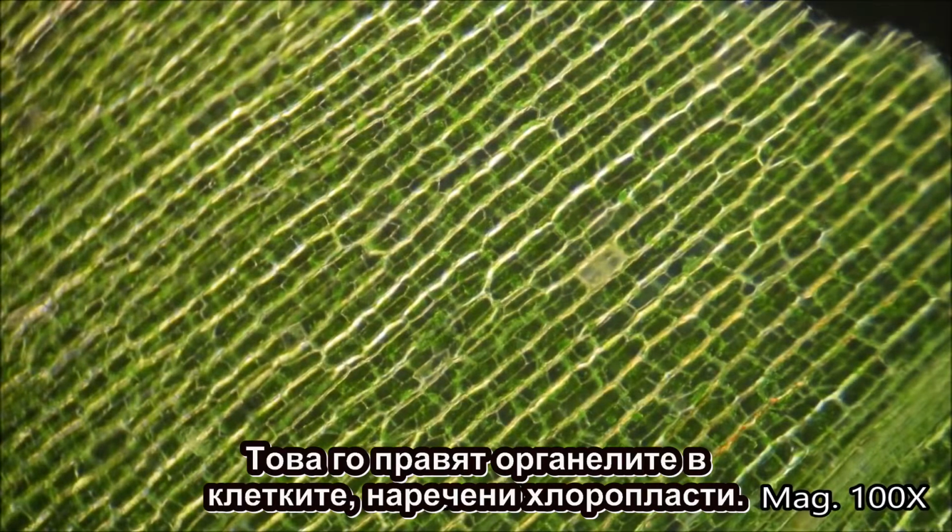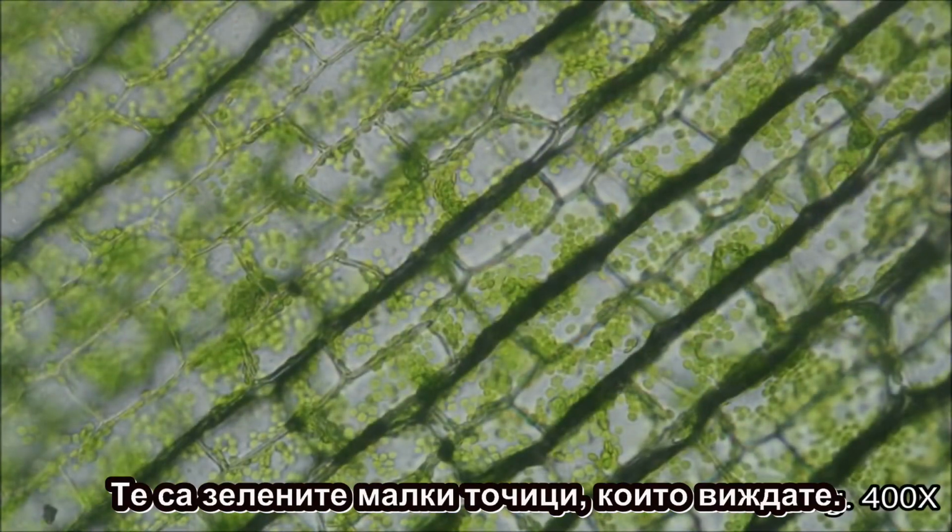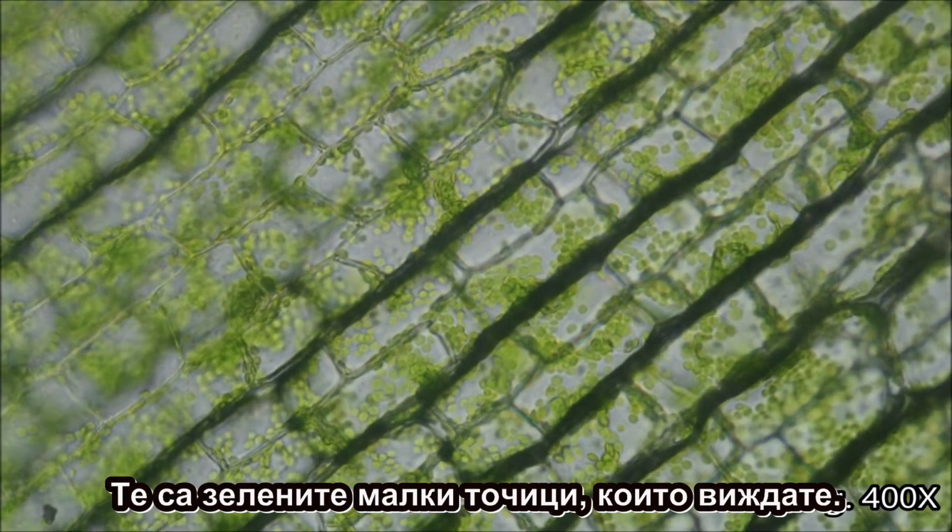This is done by an organelle in cells called chloroplasts. We can see them moving inside these plant cells. They are the green round structures seen here.